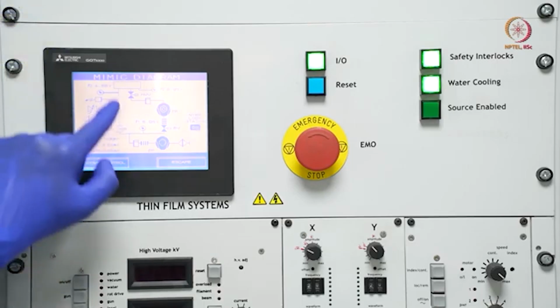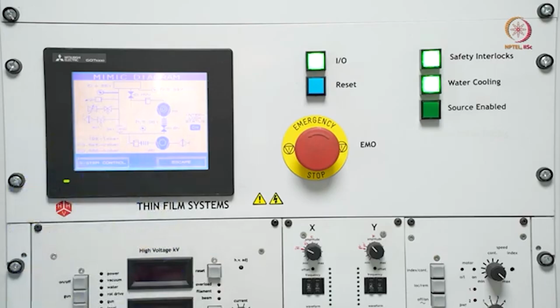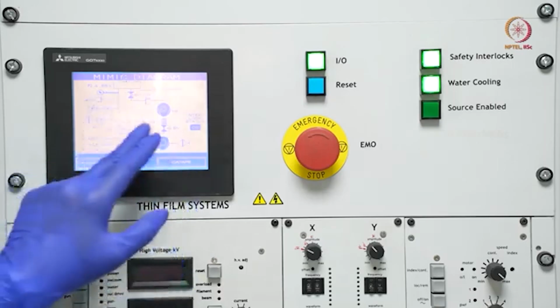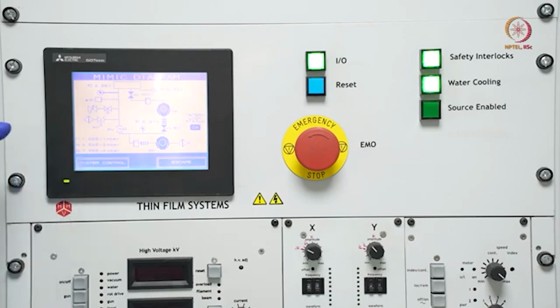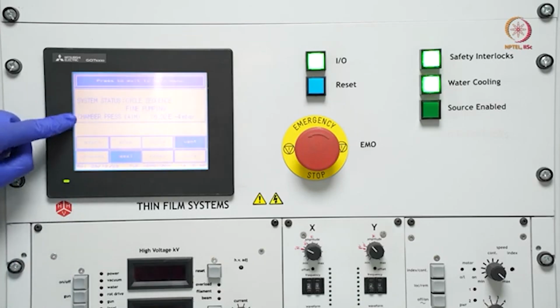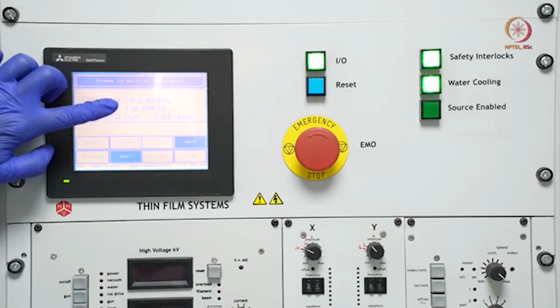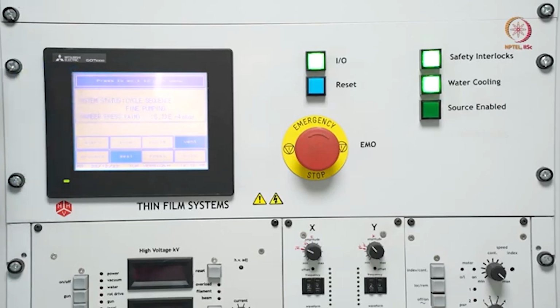Now we will wait till we can see that fine pumping starts. This will be the configuration for the next, let's say, 1 hour or 1.5 hours, pumping through this line, and it has already reached -4. So go to system control and see -4 on the gauge, and here you can see the system status as fine pumping. This will continue till the -6 range. Let it go there as it is.